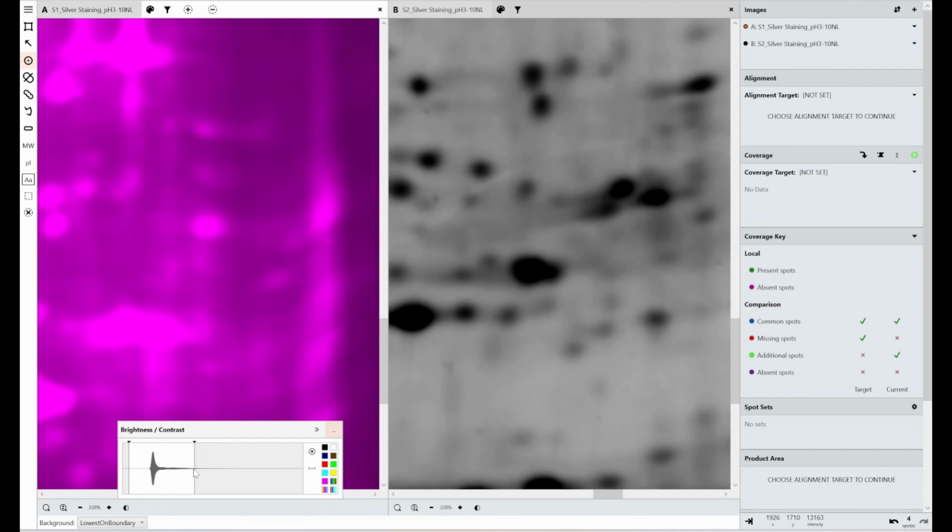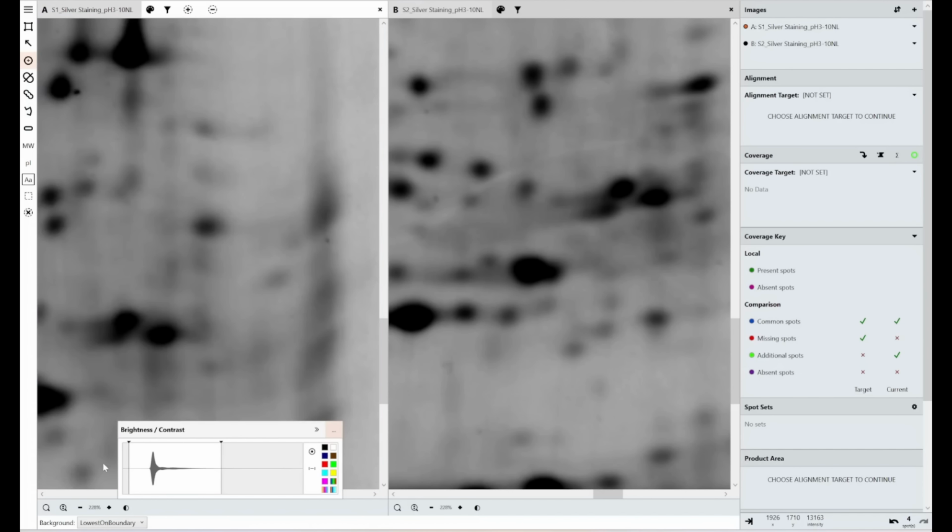So I hope that helps someone else get their head around what changing contrast does and why it's important to allow the software to do this step, and how you can use the tools in SpotMap in this instance, but also within our 1D gel and blot software Phoretix, to make your life easier when you're looking for these faint spots and faint bands without losing the data from your strong bands or strong spots.